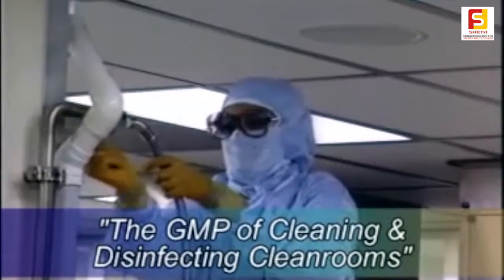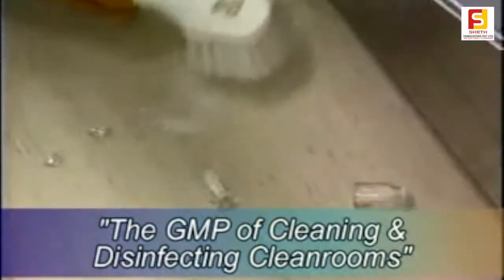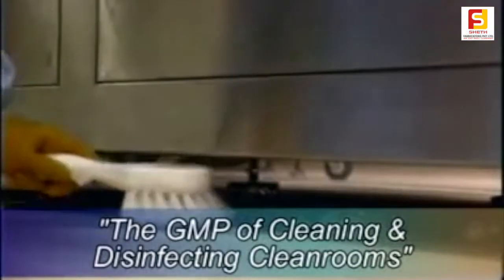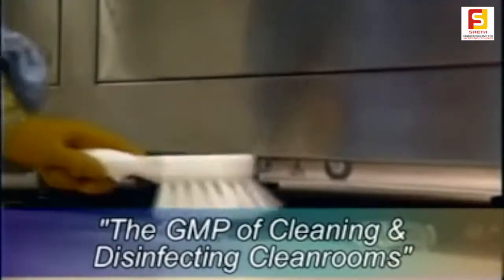All filling lines should be flushed with the appropriate cleaning agent or water as specified in the SOP. Other product components should be gathered up using a brush, cleaning cloth or monofilament broom. Every attempt should be made not to disturb the soil nor cause it to be suspended in the air.